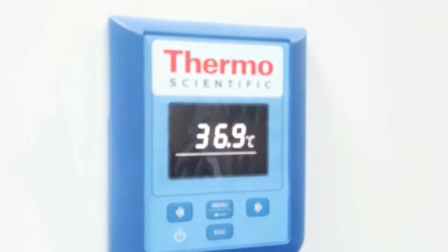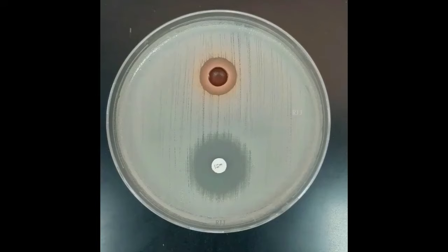After incubation, look for the zone of inhibition and measure the zone size compared with the control disk. Thank you.